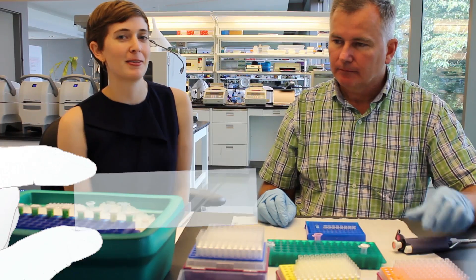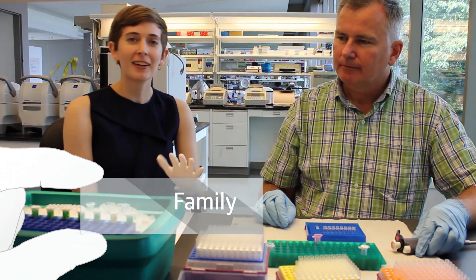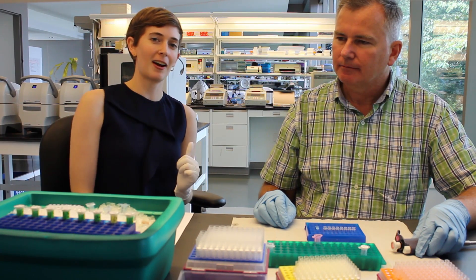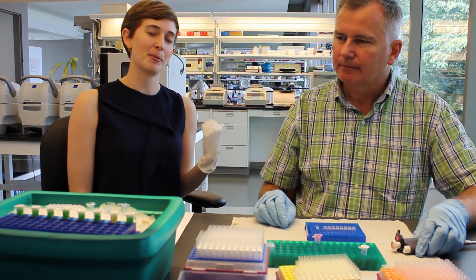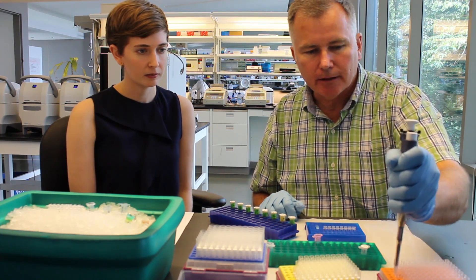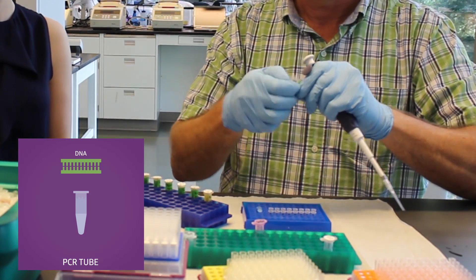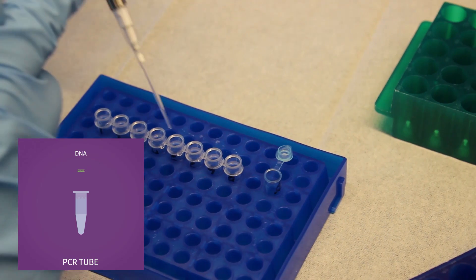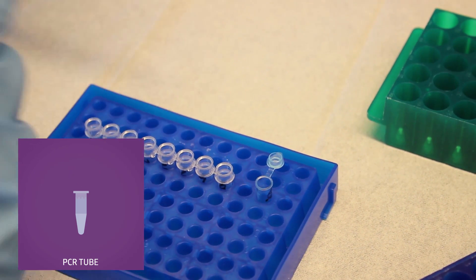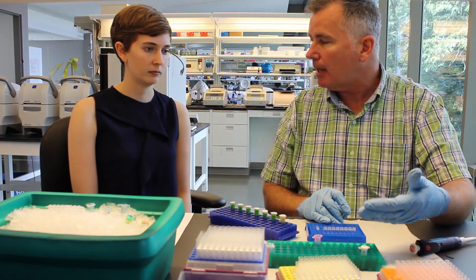We'll be doing PCR on eight species from the carrot family. And Greg extracted the DNA from these plants just like we extracted DNA from Arabidopsis plants in the last episode. We're going to take these eight samples and we're going to pipette two microliters of each DNA into these small tubes here. That's where our reactions will take place. So this is the original copy and then we'll have the new copy through PCR.